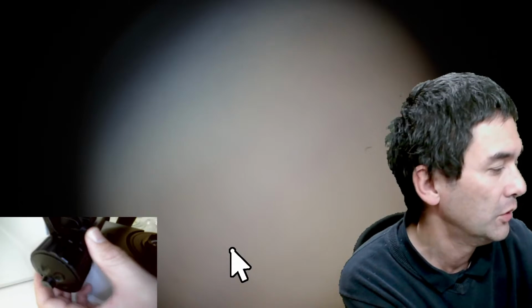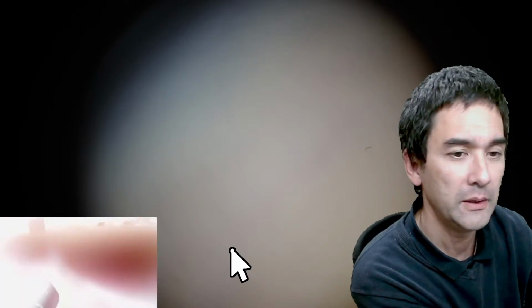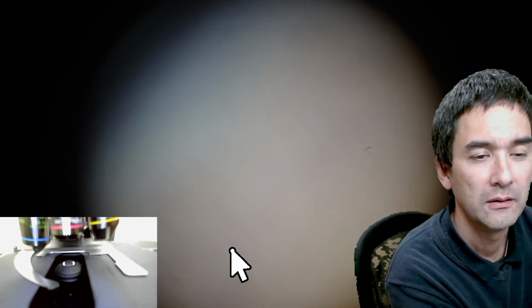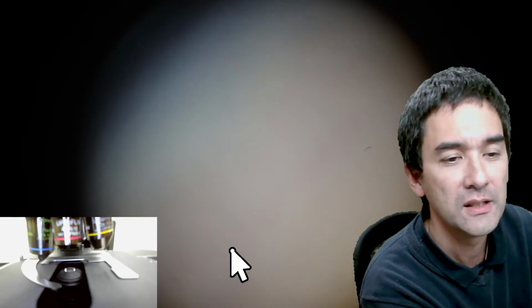But again, many microscopes might not have this. I will now show you again the stage here on top. I've got a little camera on here, and I need to focus this again. There is a little lens that I can turn. I think that's better.